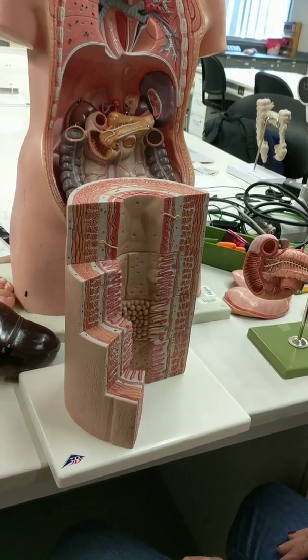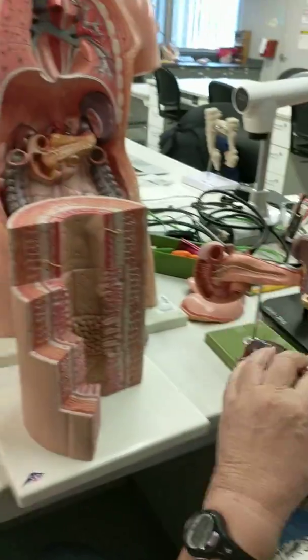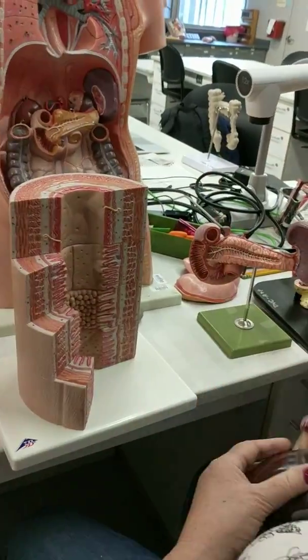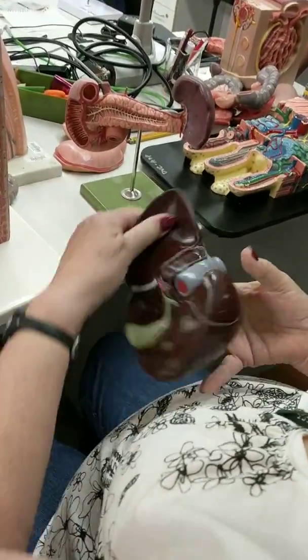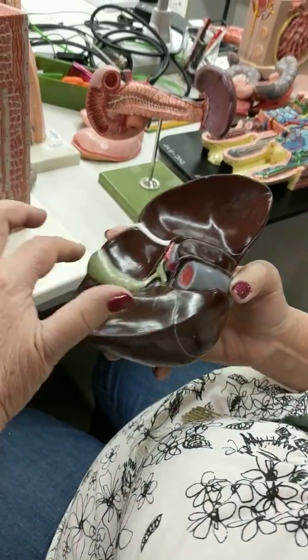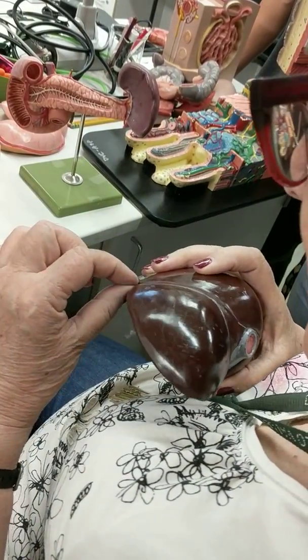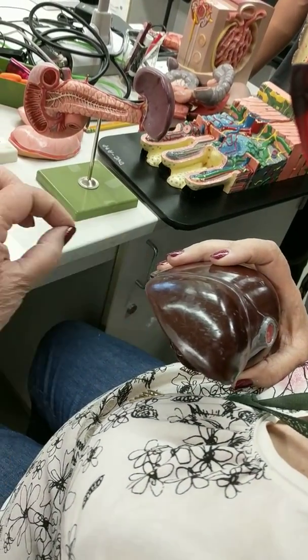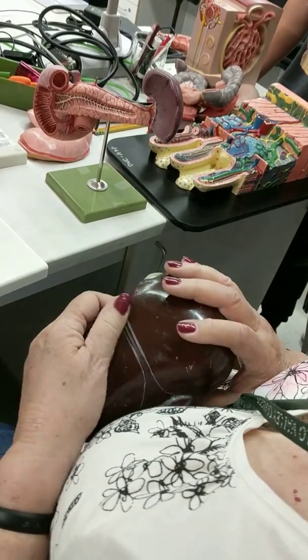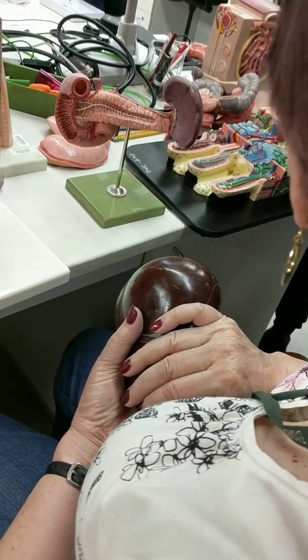Yeah, no big deal. Okay, so the liver here is an accessory gland. So is the pancreas, right lobe, left lobe, caudate lobe, and quadrate, which is four-sided. This is called a falciform ligament, and also sticking out would be the ligamentum teres, or round ligament, which is a remnant of the umbilical vein. Now, I've covered a lot right now, so you need to go back and study it some more.